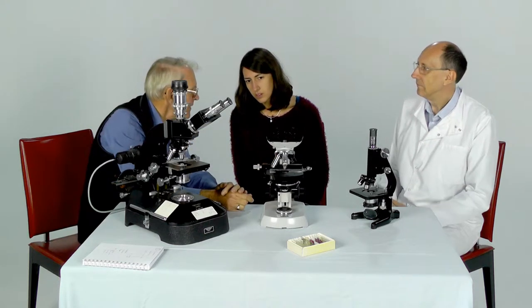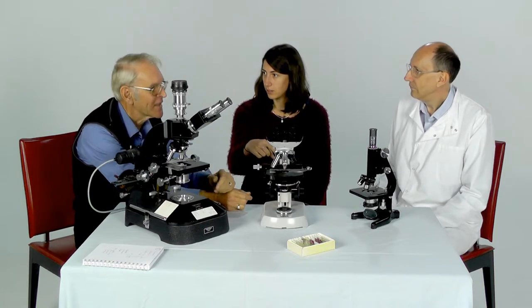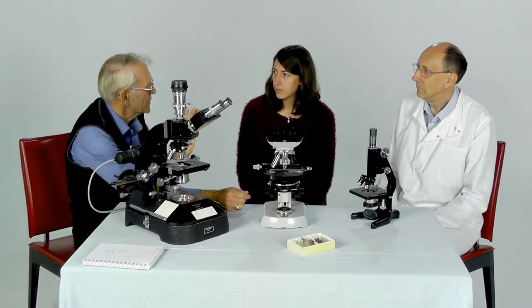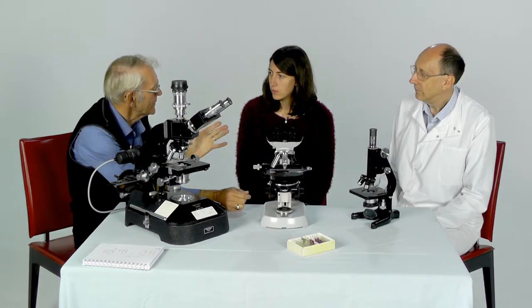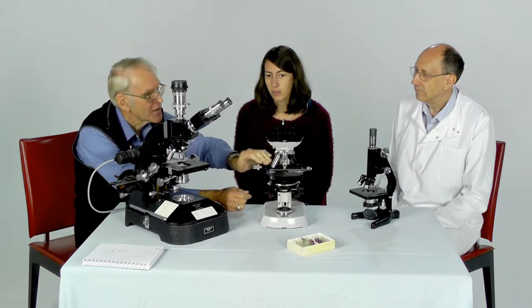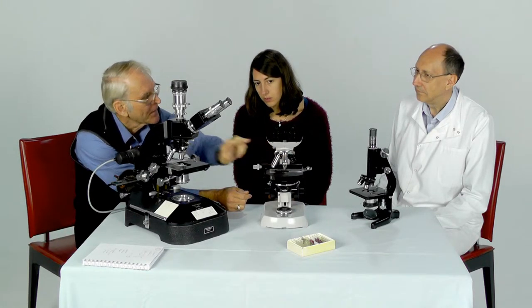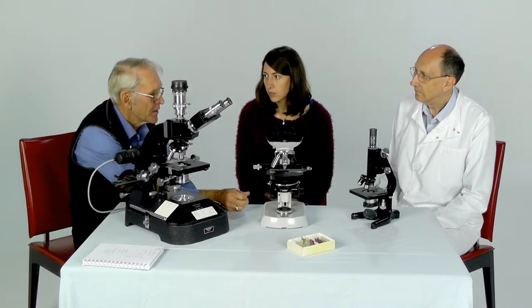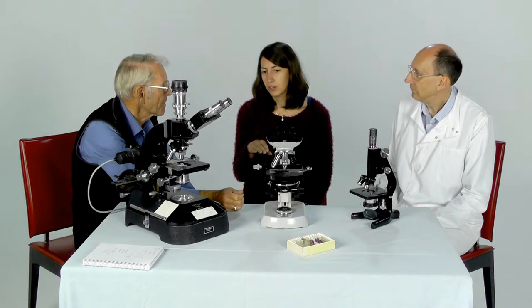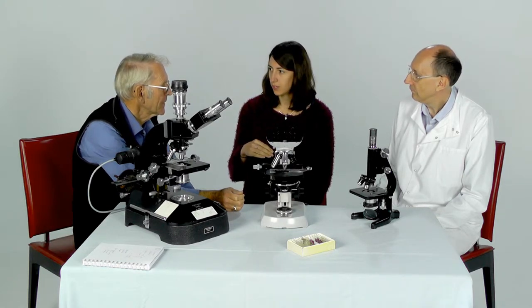Usually the lowest objective is somewhere in the range of 4 or 5. Then we move on to the 10 and then up to the times 40, and there's usually a very high-powered lens which magnifies approximately 100 times. So when I'm looking at something, it's at 10, 40 or 100 times magnification?